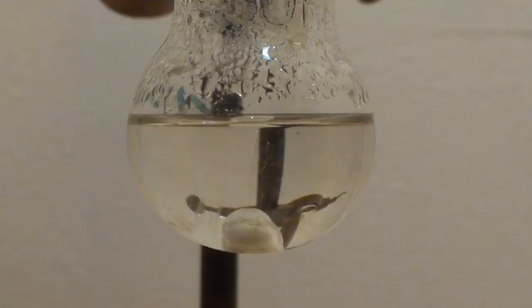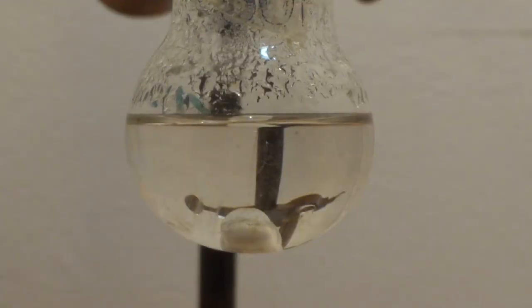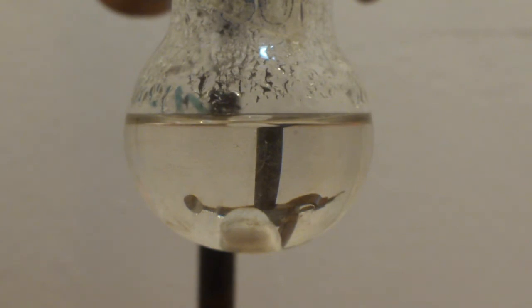After about one hour, the heat was turned down and we allowed the flask to cool down. As you can see, there is a distinct layer on top of the water-sulfuric acid mix. This is our toluene. It is reasonably pure so it smells better than most commercially available toluene.